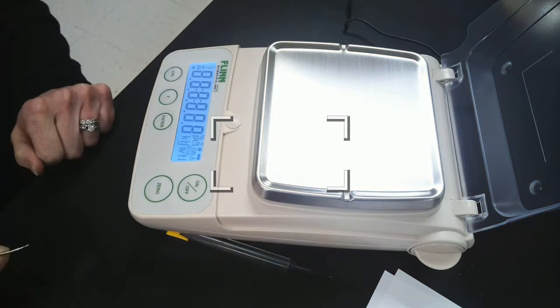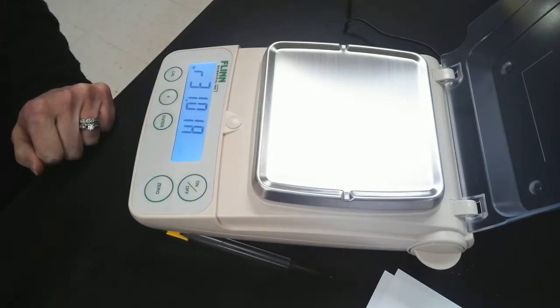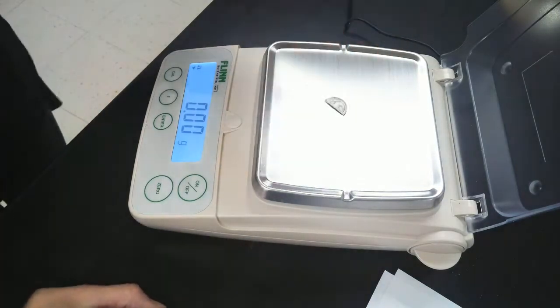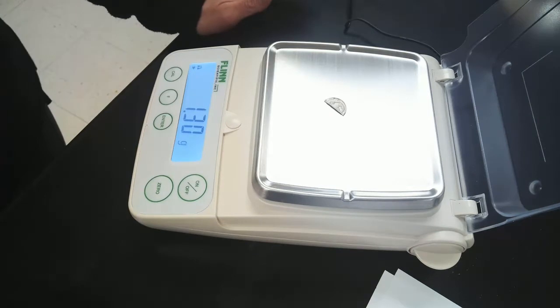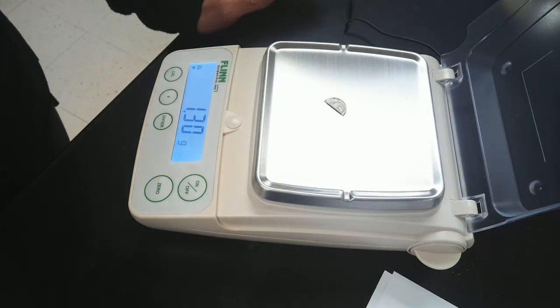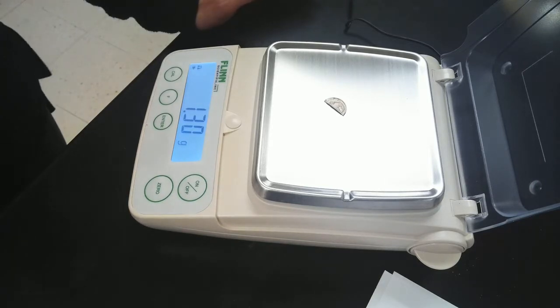So turn it on, let her boot. And here's the only piece of data that I have to record today. It's just the mass of my alloy sample. So I'm getting about 1.30 grams. 1.30 grams. Cool.